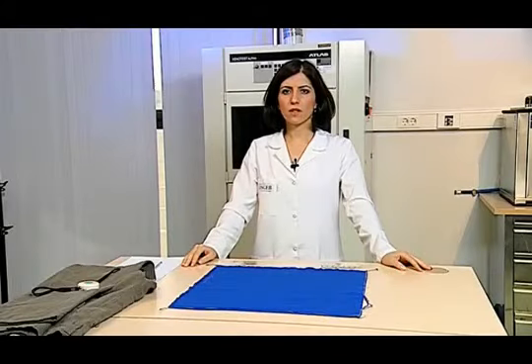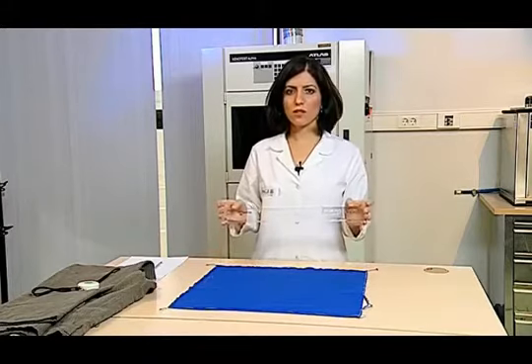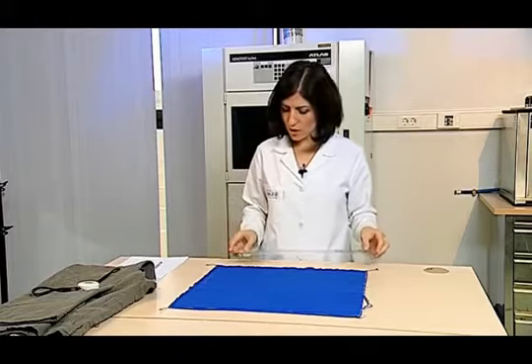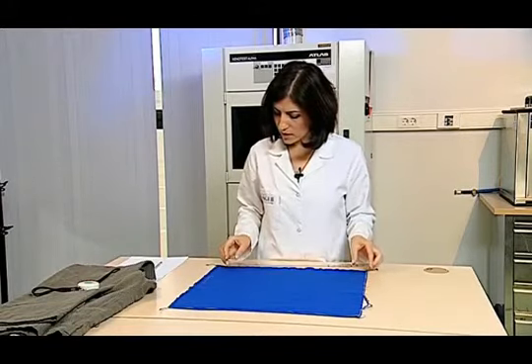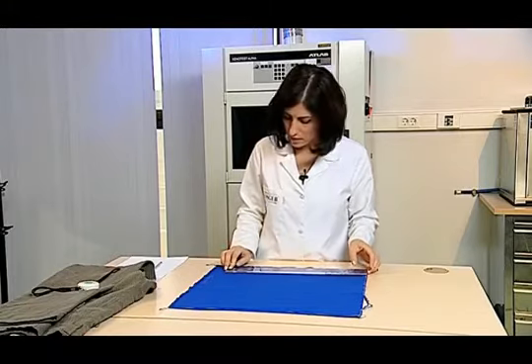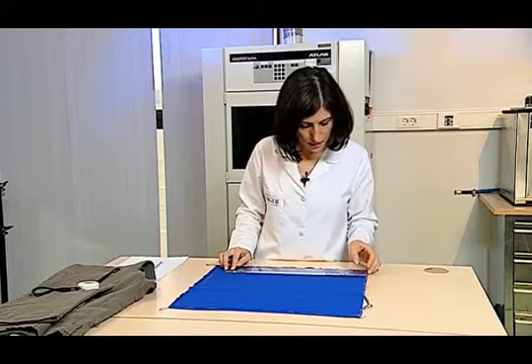After washing and drying, the test samples are conditioned in standard atmospheric conditions. A dimensional change ruler is used to measure the percentage change of the test sample. The 0 point of this ruler is placed at the point that we measure. The distance between one edge to the other is measured.